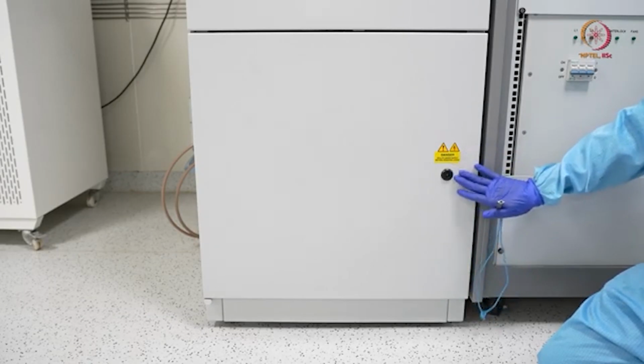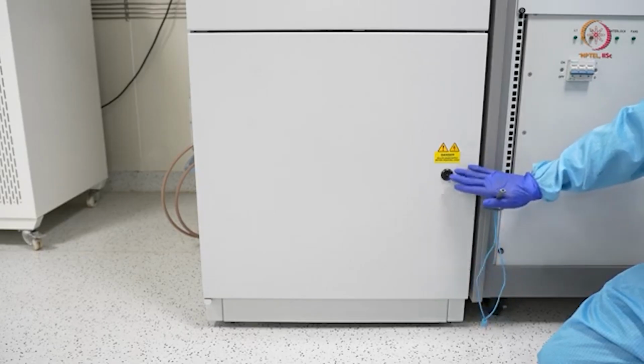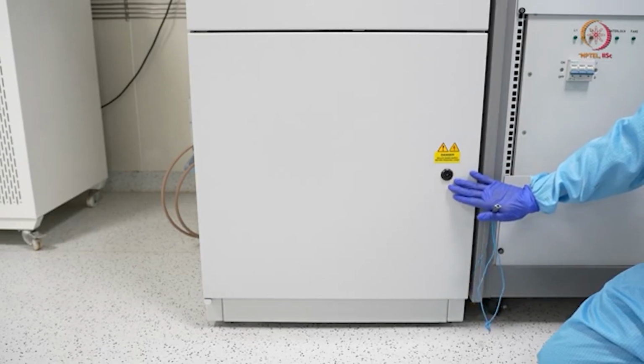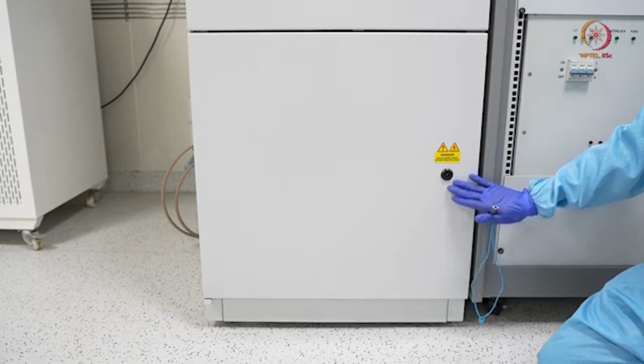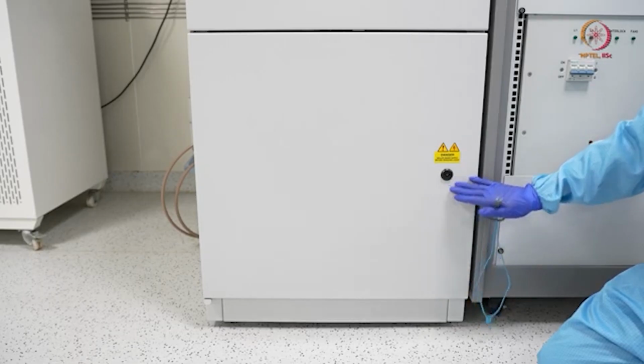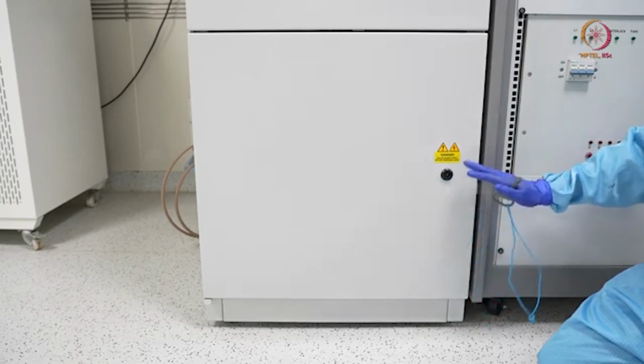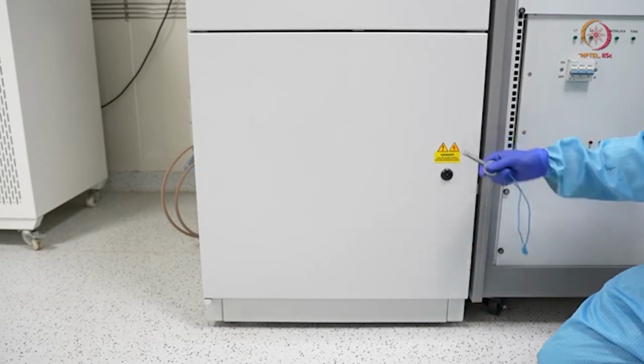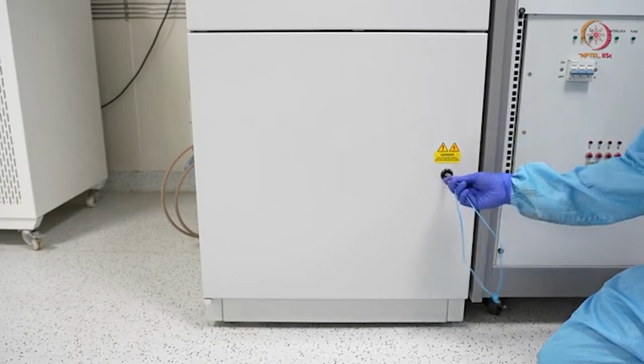This is connected to one of the safety interlocks. If this is on, then your tool can only create vacuum, but it will not go to the process step, or the deposition step. That is for safety reasons. And you can see here this is an electrical hazard sign. So now you know what to expect inside.